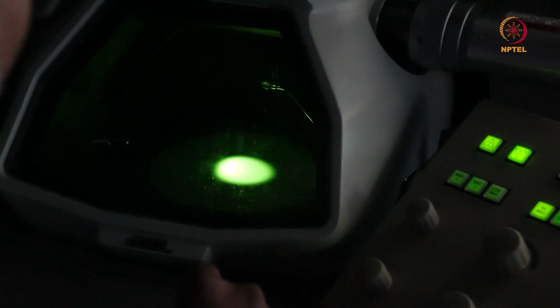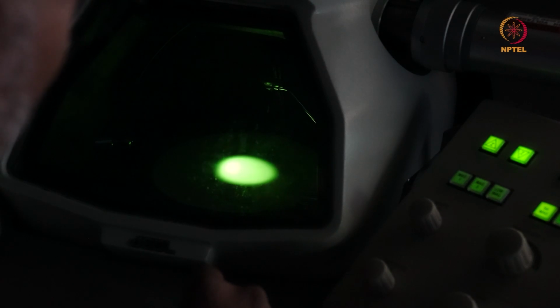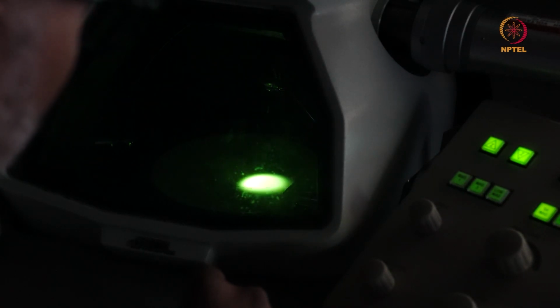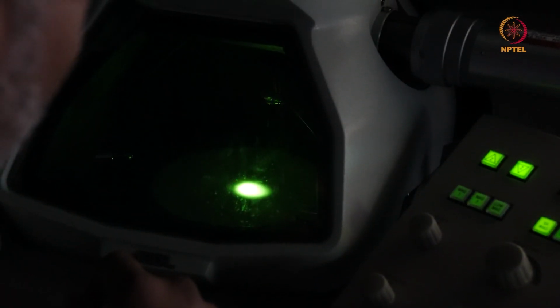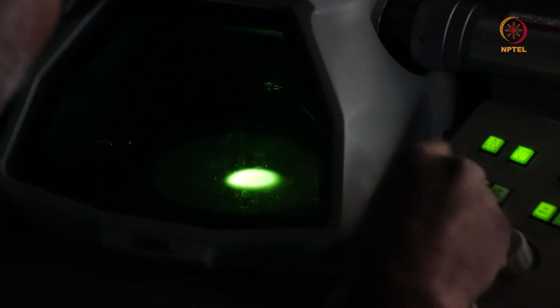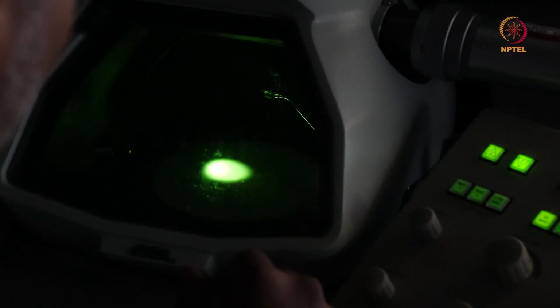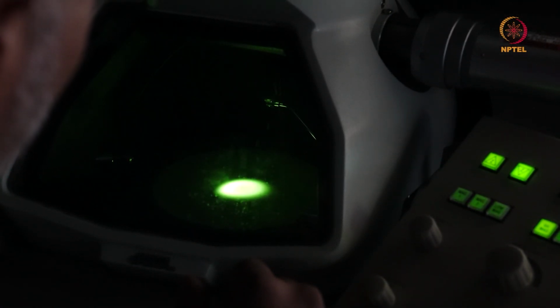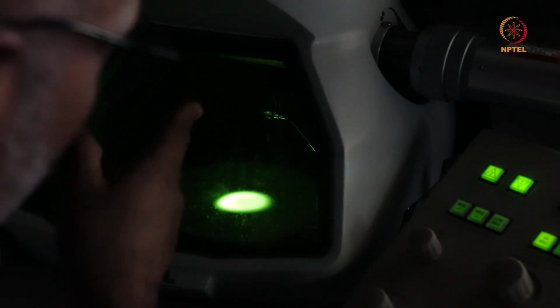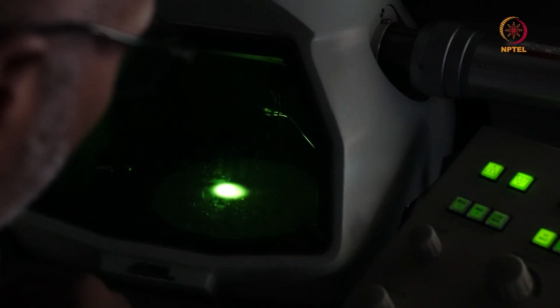Now, after I make it as circular as possible, on either side of the crossover, you see this little misalignment, which is again because the aperture is not perfectly centered. So what I'm trying to do is move this with the beam shift knob, so the top left edge of this circle is where the crossover point is coinciding.